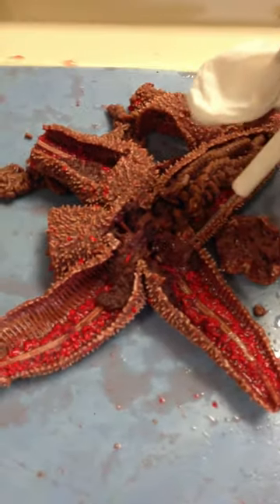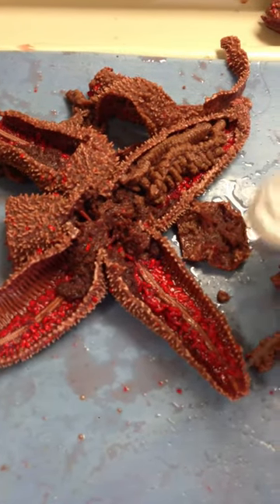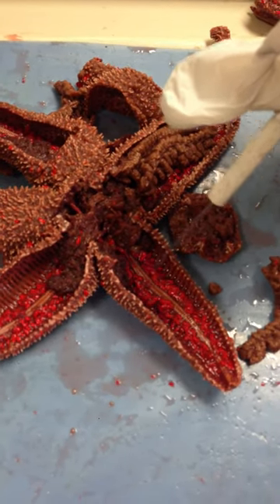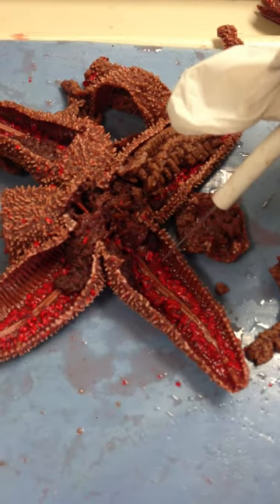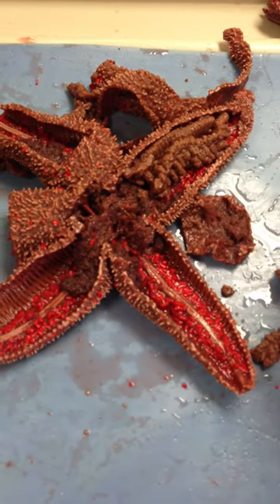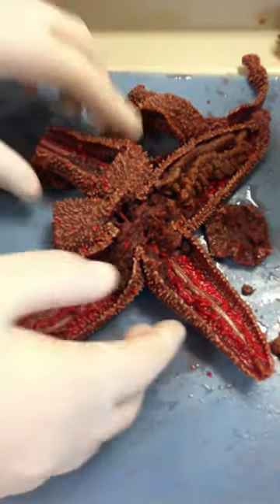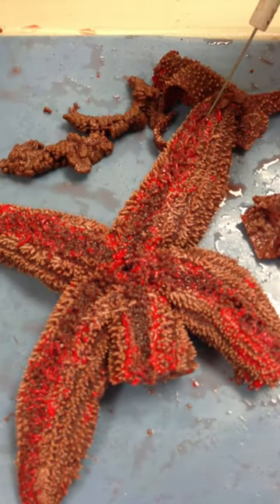The ring canal then attaches to the radial canal, which is going to run down each arm. You can't see the radial canal because it's underneath the ambulacral ossicles, which are all these white structures, and the line in between is the ambulacral groove. The ambulacral groove can be seen on two sides of the organism — we're going to flip it really quickly — and this would be an ambulacral groove here.